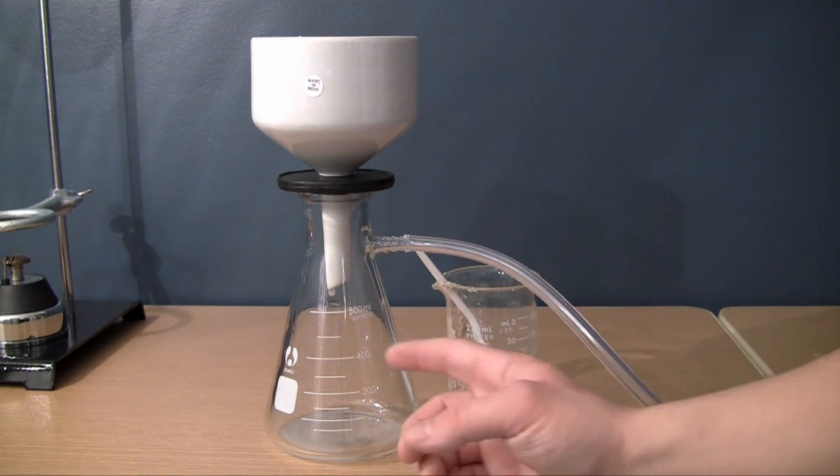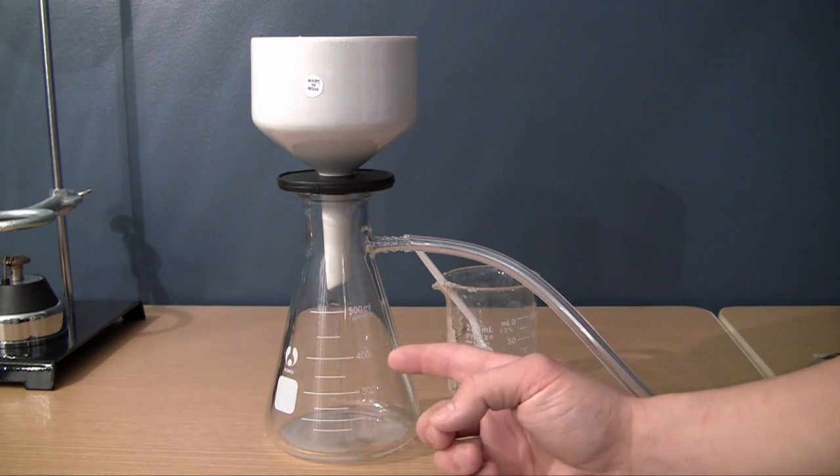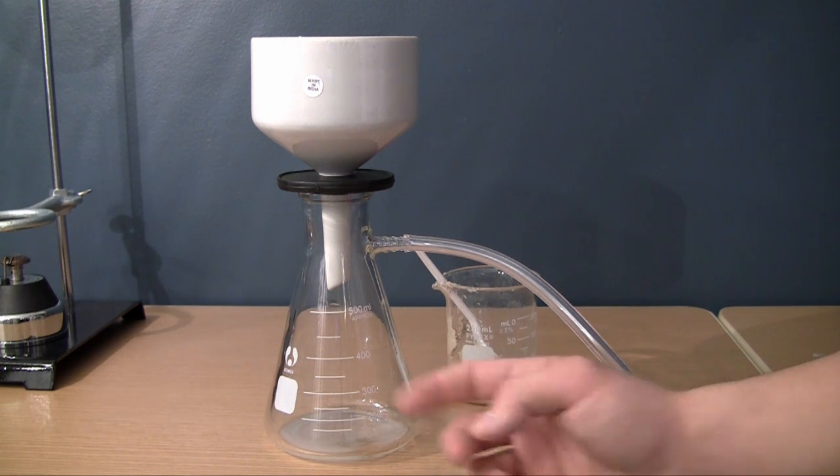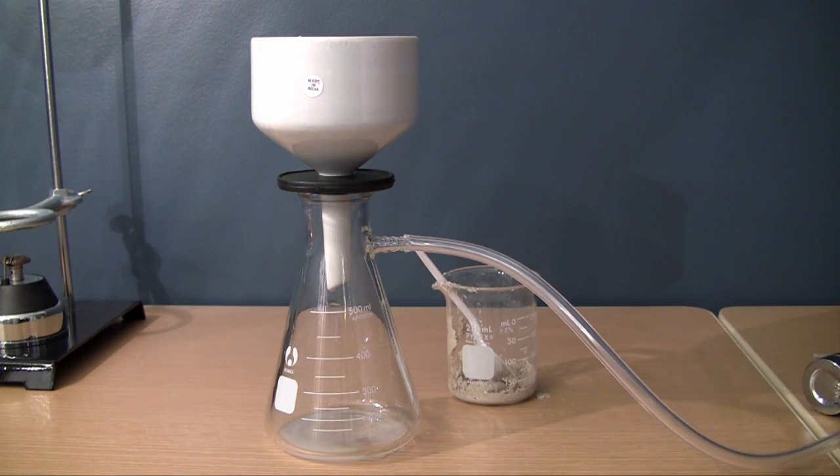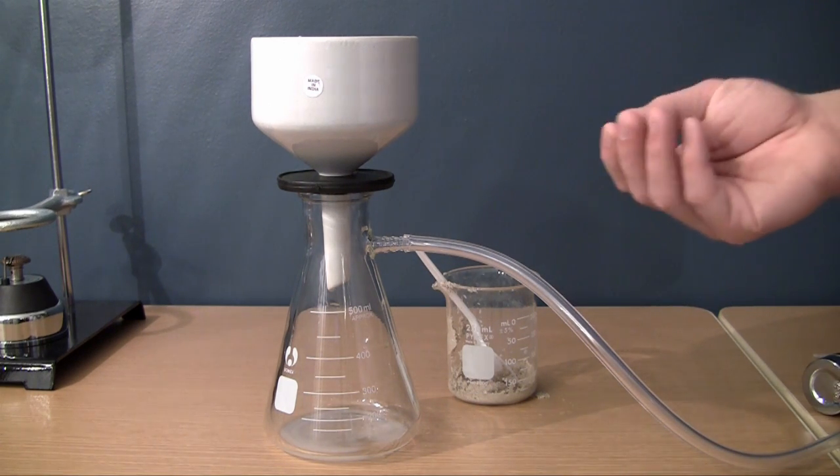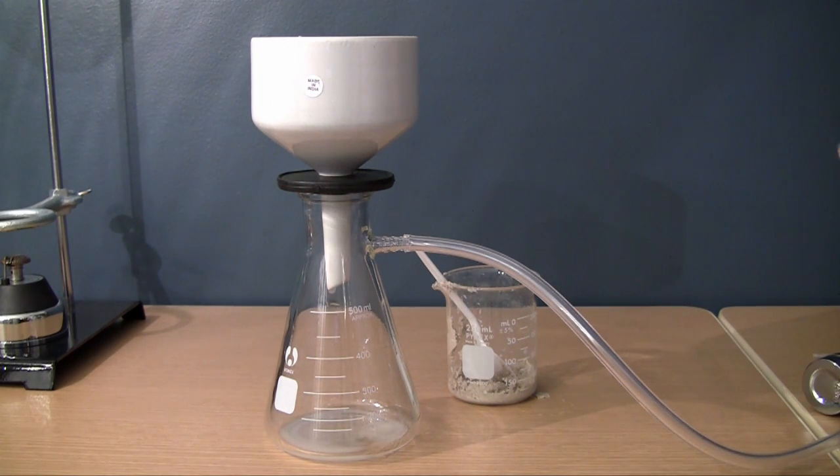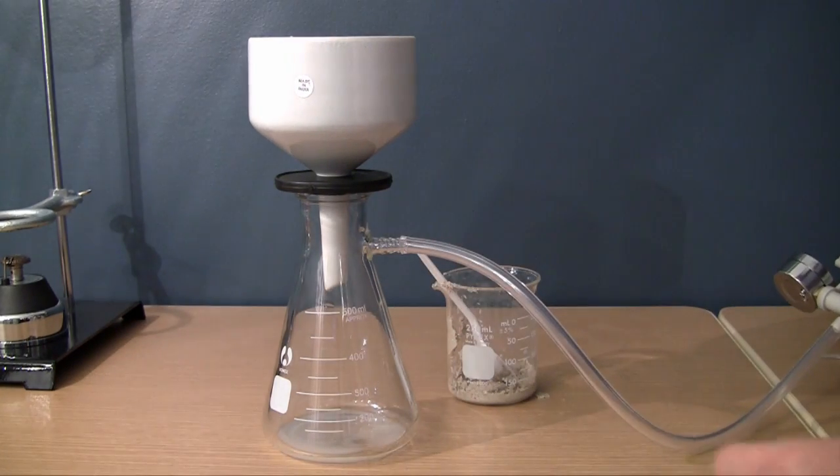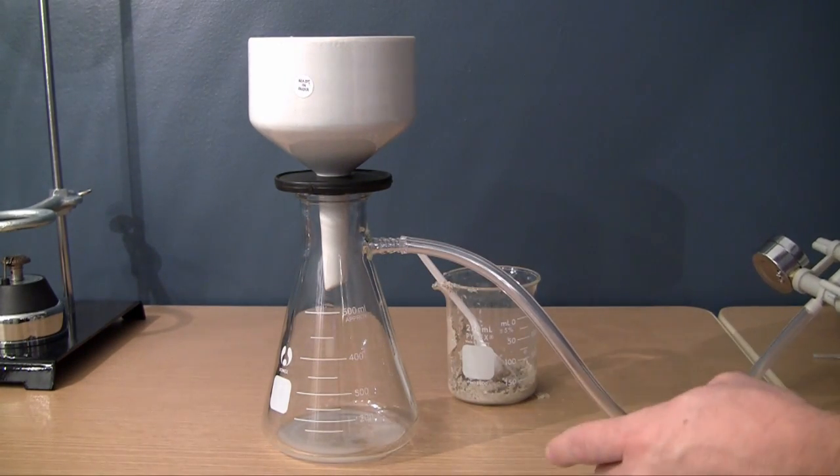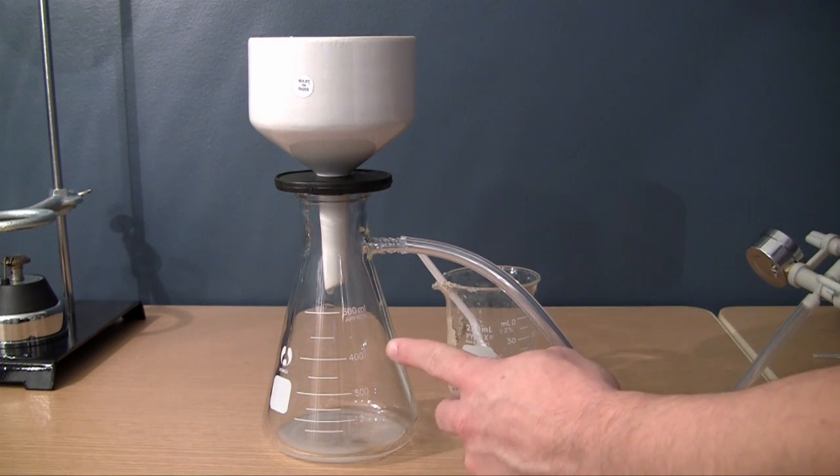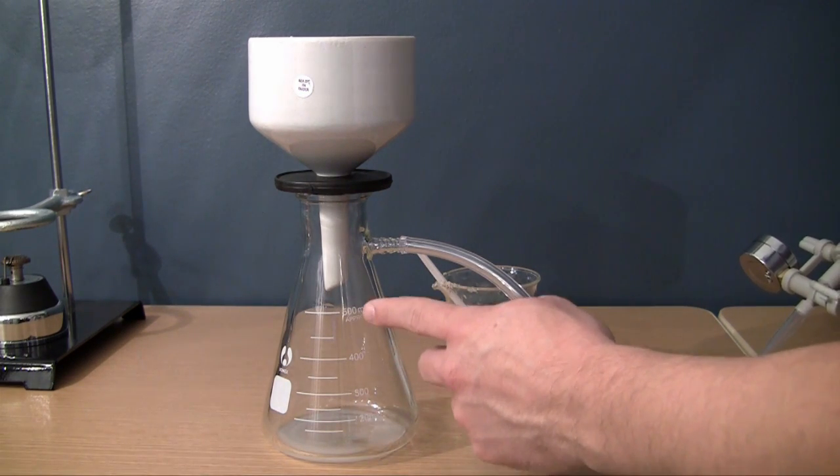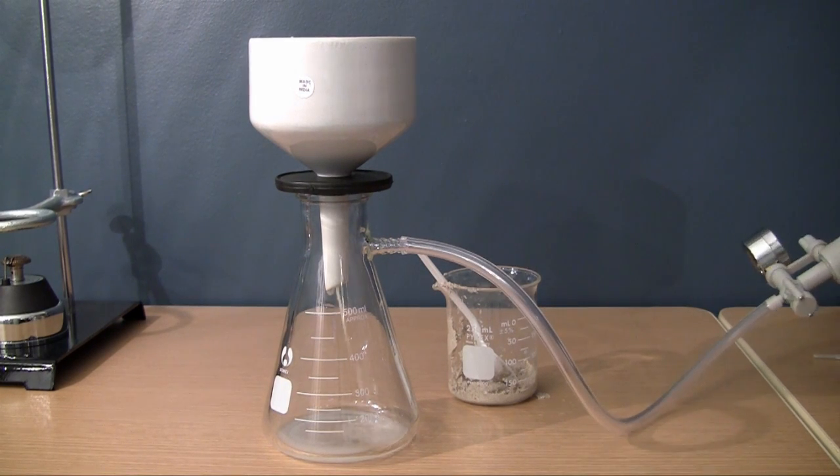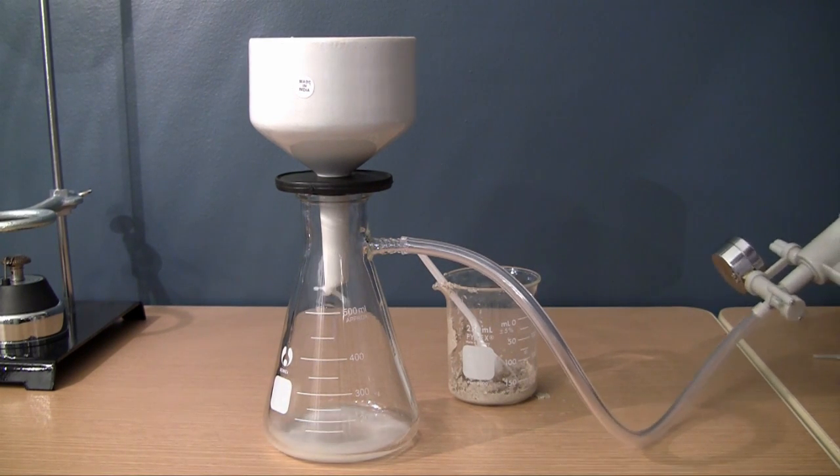Now, as you can see, this is filtering, of course, but it's going really slow, drip by drip by drip. At this rate, it's going to take about an hour to get all that water separated from the sand. So what you do is you make sure you have a good connection here. I'm going to go ahead and start pumping. And whenever I do, keep an eye on this water right here. It's going to turn from a drip to a stream. And let me go ahead and start pumping right now and check that out.